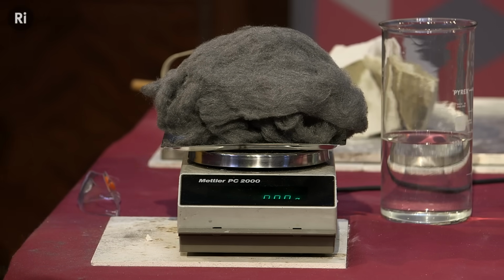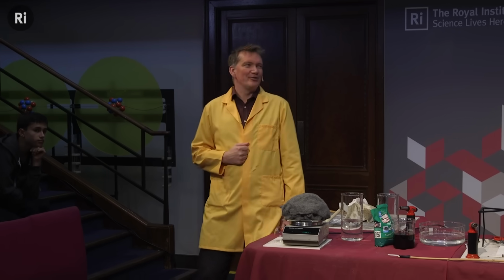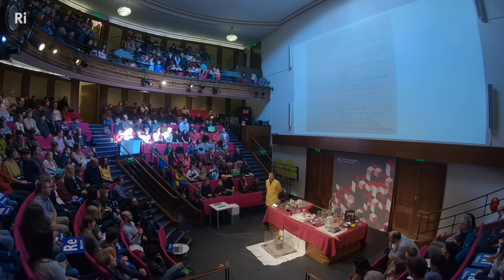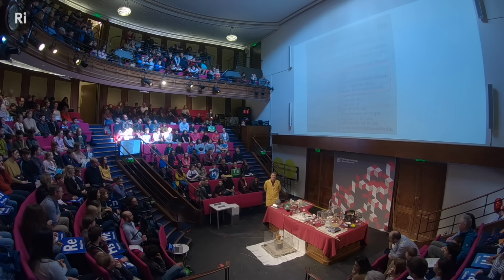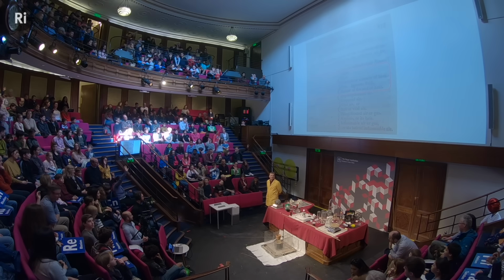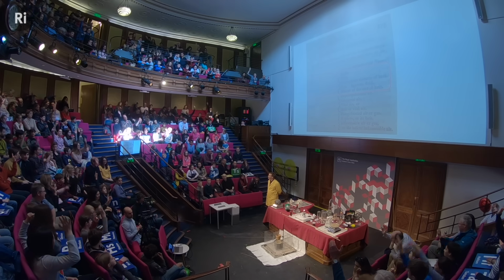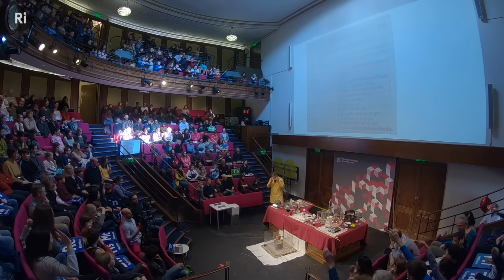Okay, so we have 3 possibilities. So actually, maybe we'll have a vote to see who's right. Who thinks that the mass will stay the same during the reaction? No one. Who thinks the mass is going to go down when it burns? There's quite a few hands there. Who thinks it's going to go up? Even more hands. I think if we had to ask the audience, we would say it's going to go up. Well, let's try it.